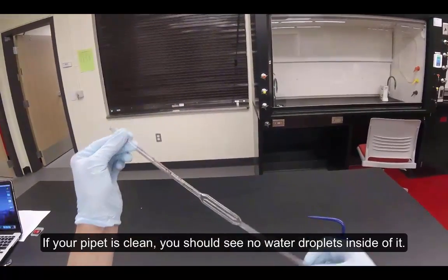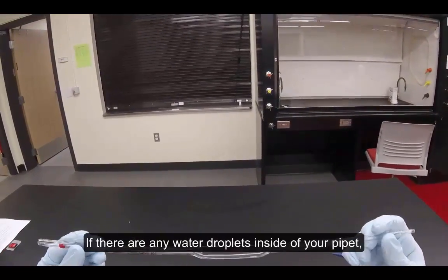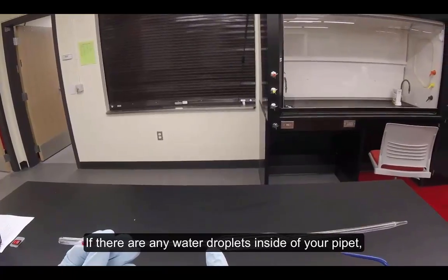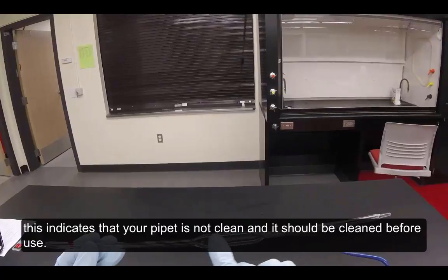If your pipette is clean, you should see no water droplets inside of it. If there are any water droplets inside of your pipette, this indicates that your pipette is not clean and it should be cleaned before use.